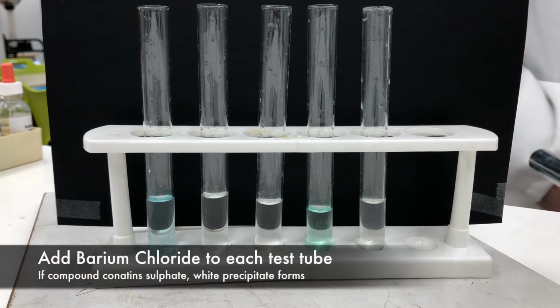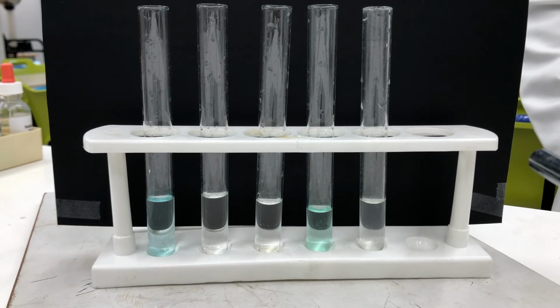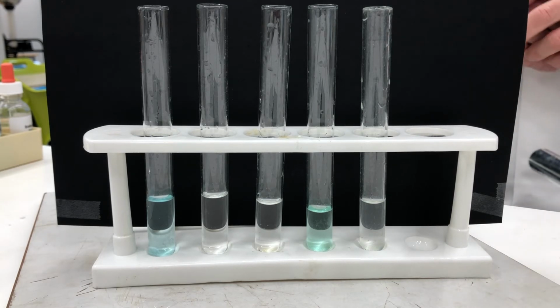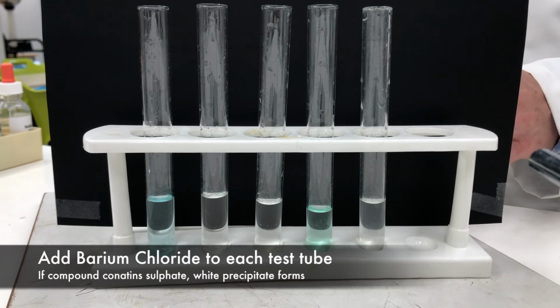And I'm going to add some barium chloride. Now, we need to be careful with barium chloride. It is a little bit poisonous, so we need to be careful. If I get it on my skin, I'm going to wash my hands immediately. I'm wearing my lab coat. I've got my glasses on again. But I'll add a few drops of barium chloride to each of these. They are all sulfates, and we will expect to see a white precipitate in each of these because that's the sulfate test. If there is a sulfate present, we get a white precipitate when we add barium chloride.